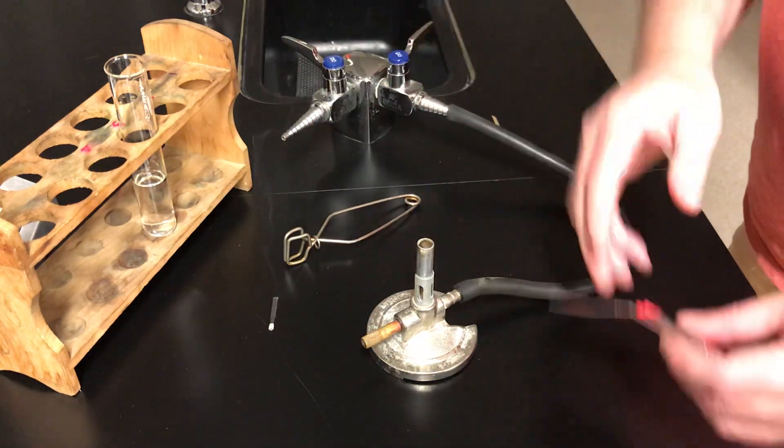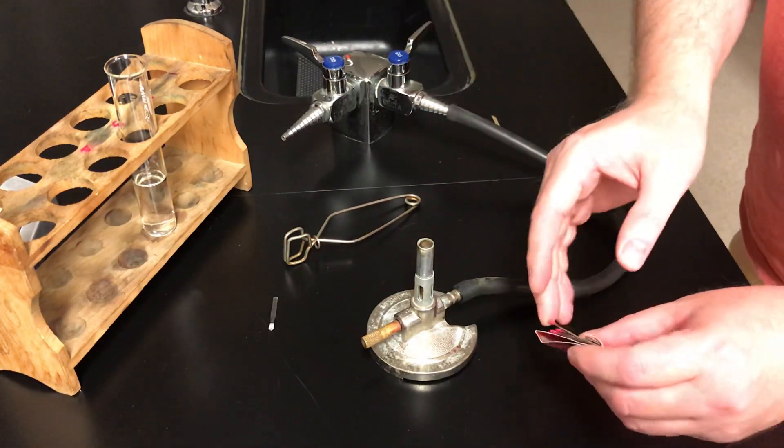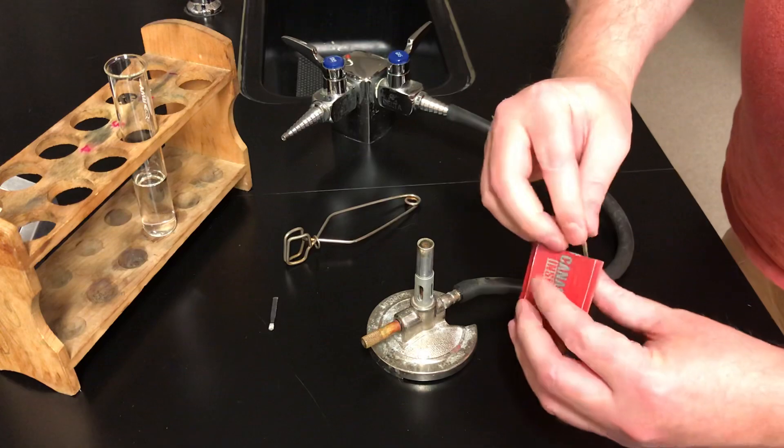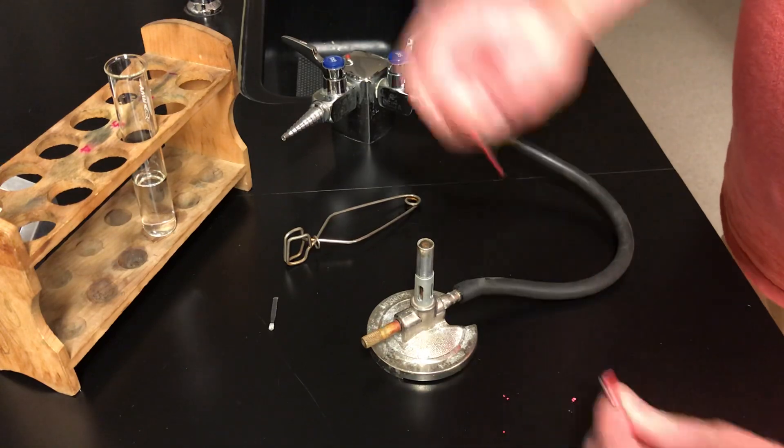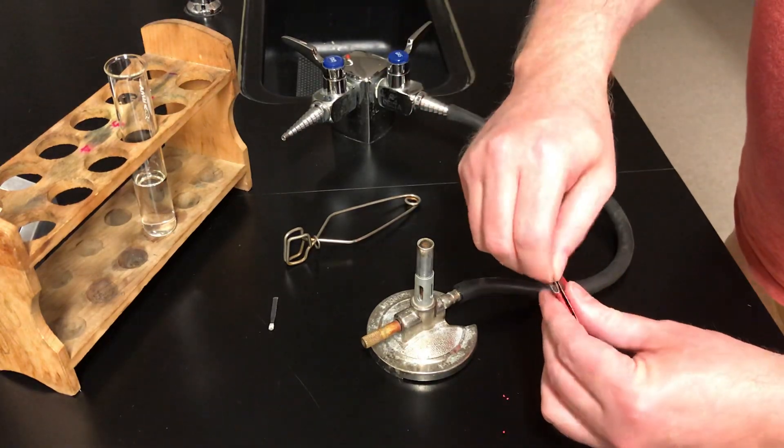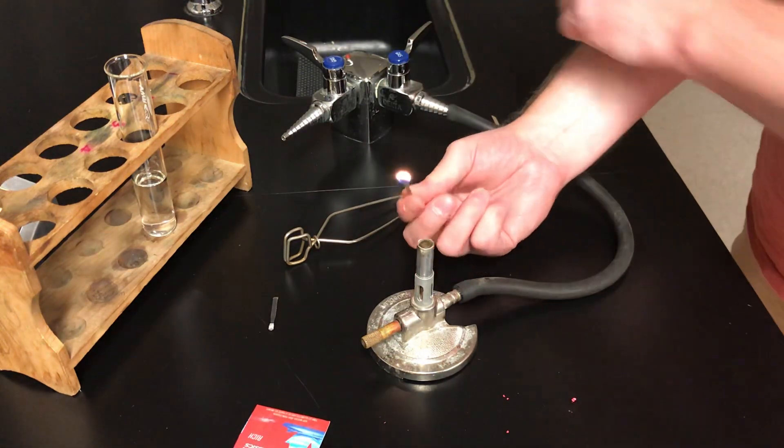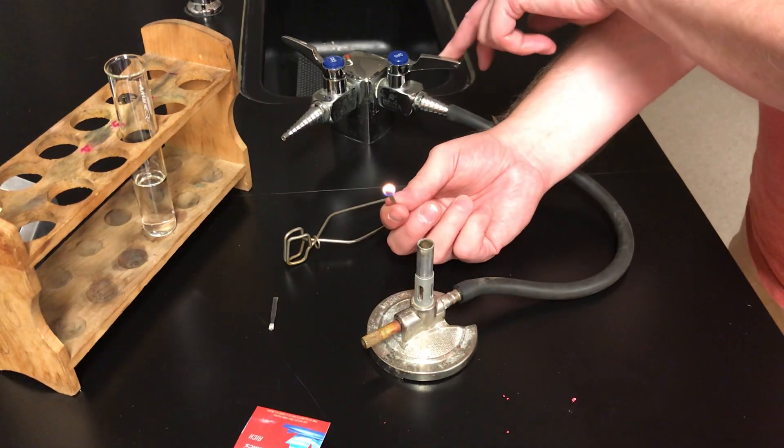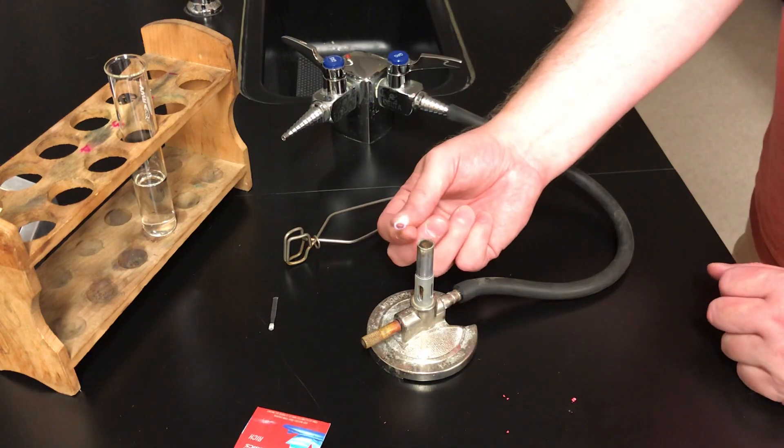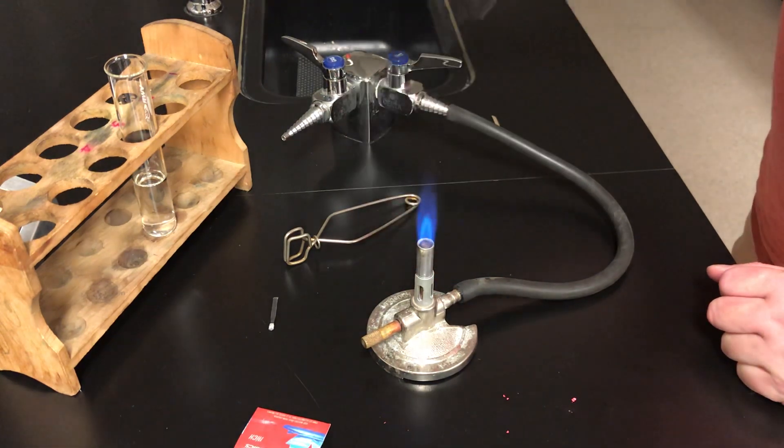So one more time. Turn the gas off. Take your match. Light your match. Point it up away from your hand. Bring it near the burner. Turn the gas on. Bring the match from the side to the mouth. And you're good.